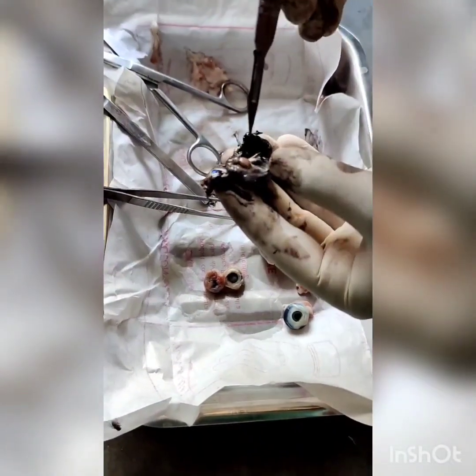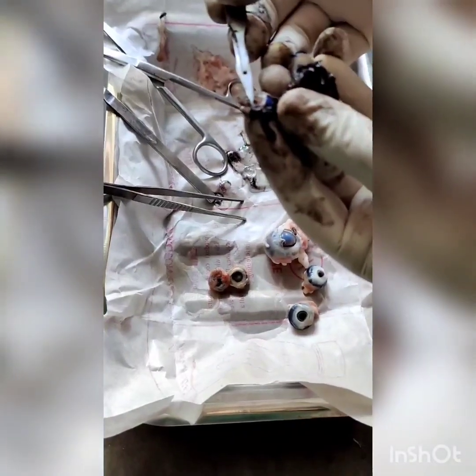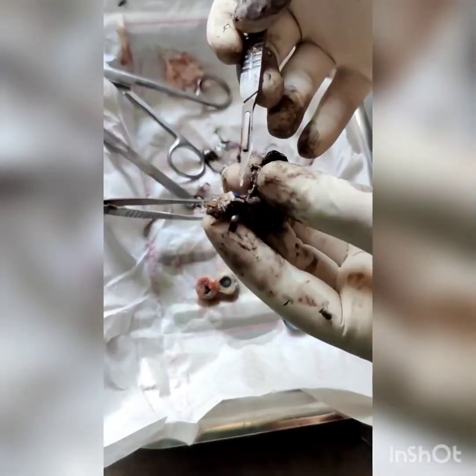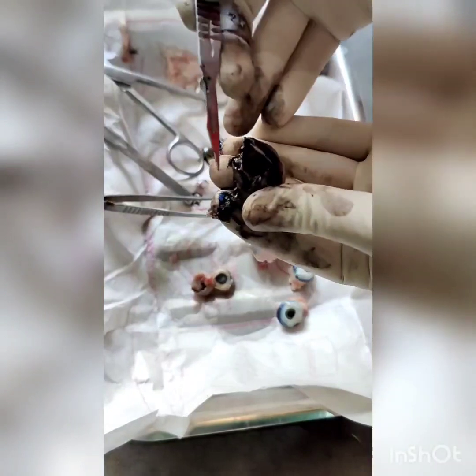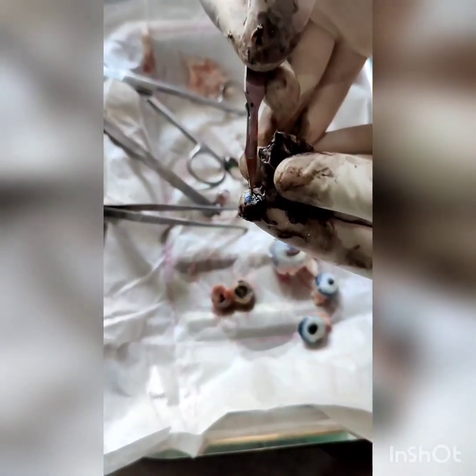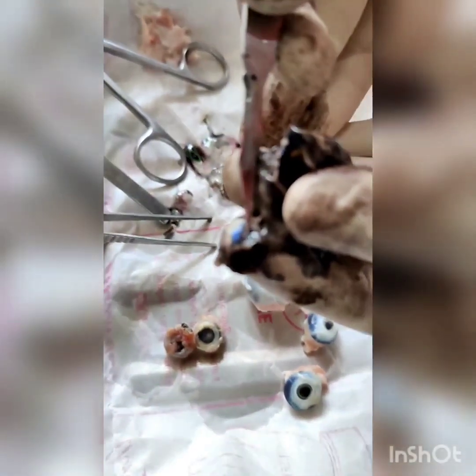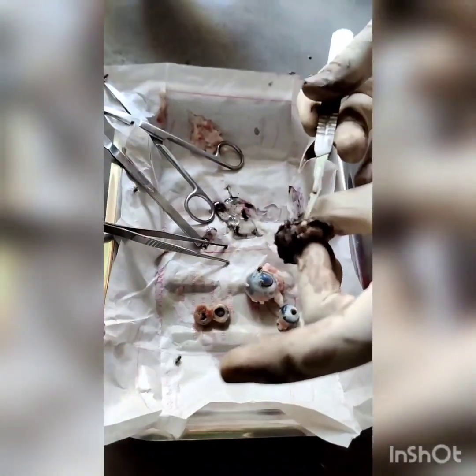There is a serrated border near the ciliary body known as the ora serrata. At the center of the posterior pole of the eyeball, the retina presents an oval structure known as the macula lutea. At the center of the macula lutea there is a point called fovea — the depressed area is the fovea centralis — where vision is most acute. At this point the retina is very thin due to the absence of some cell layers.